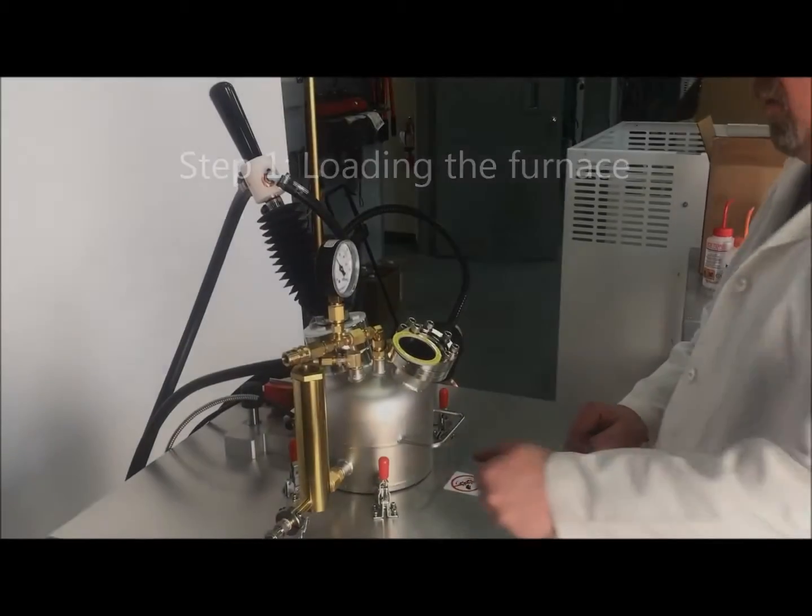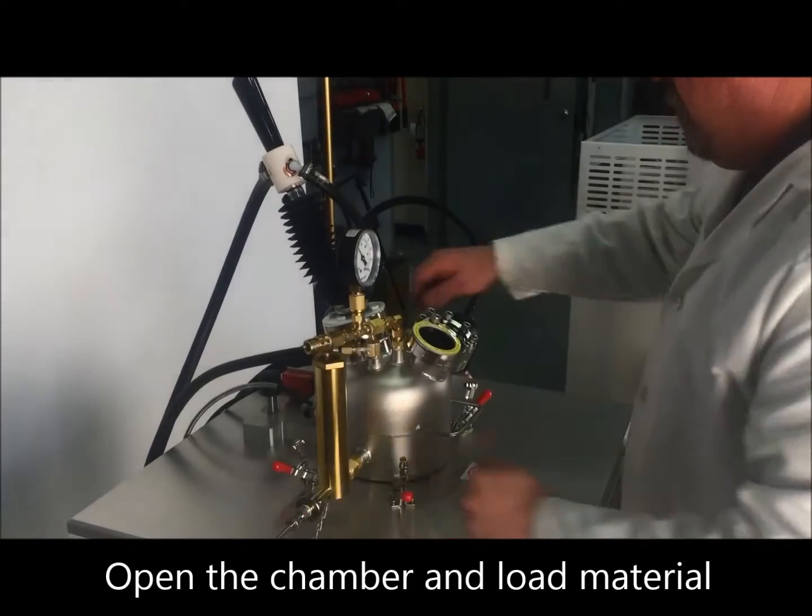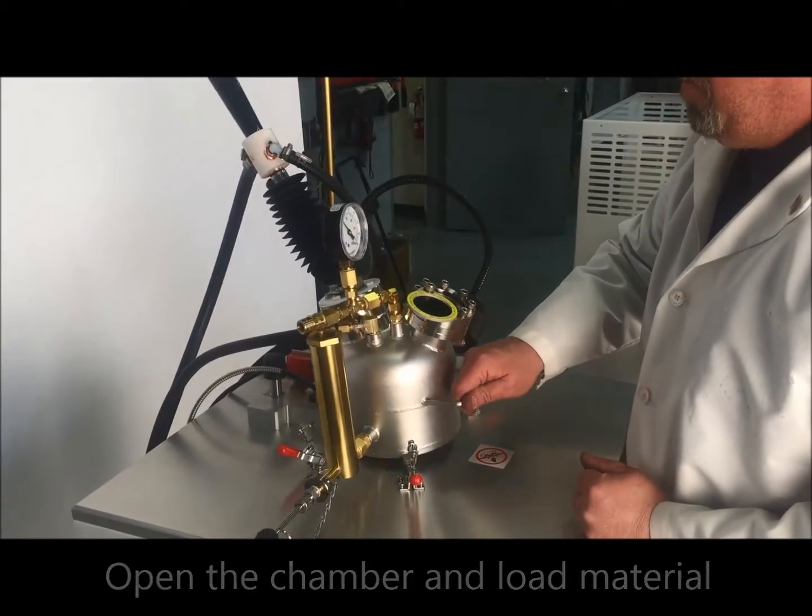Our operator will start by making a button in one of the selected hearths. The hearths can have custom cavities tailored to customers' needs.